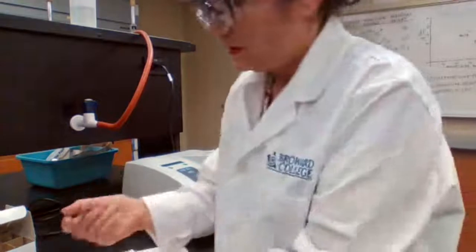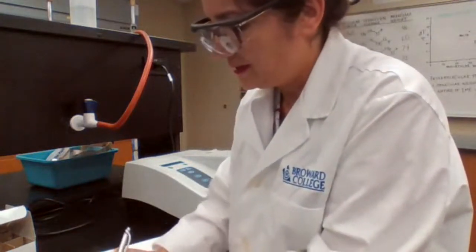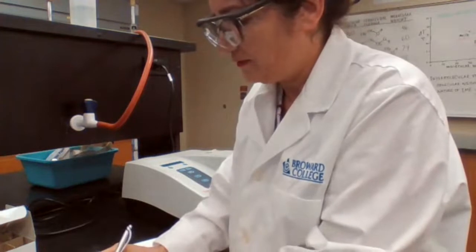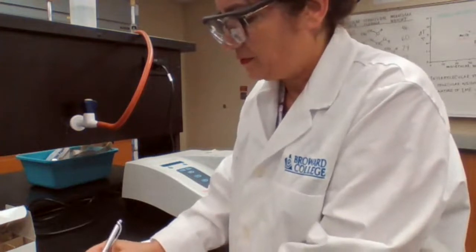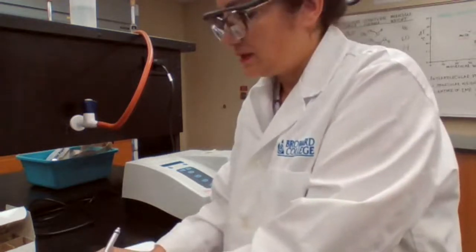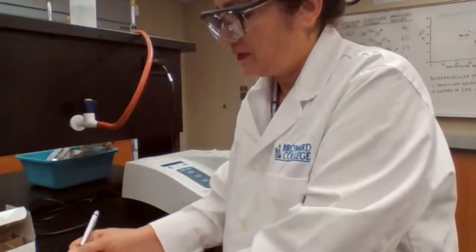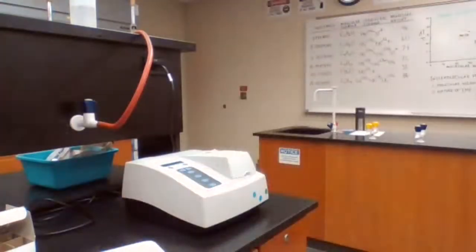So for A, I have 100%. For B, I started at 1:57. I have to wait to 2:03. For C, I'm going to start at 2. I have to wait to 2:05. So let me start with the C.